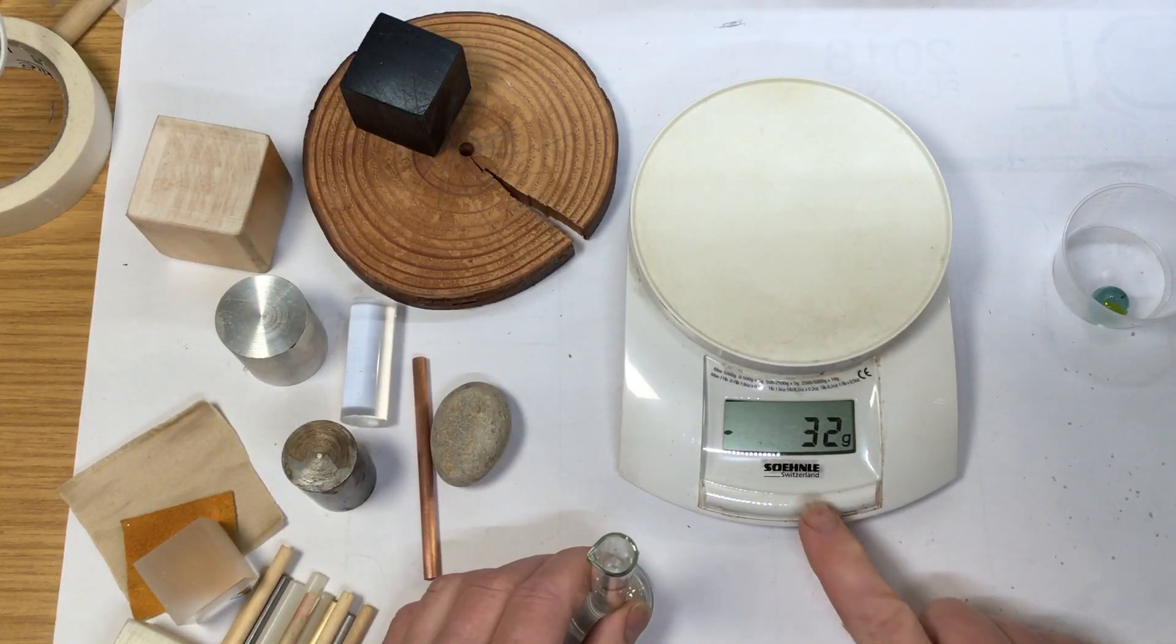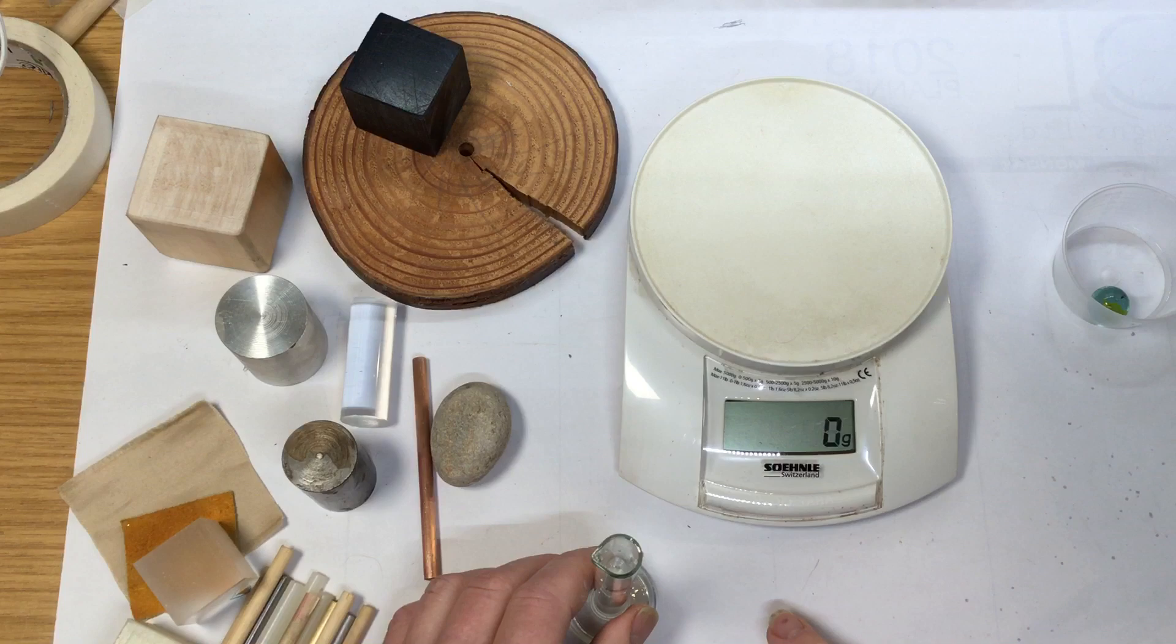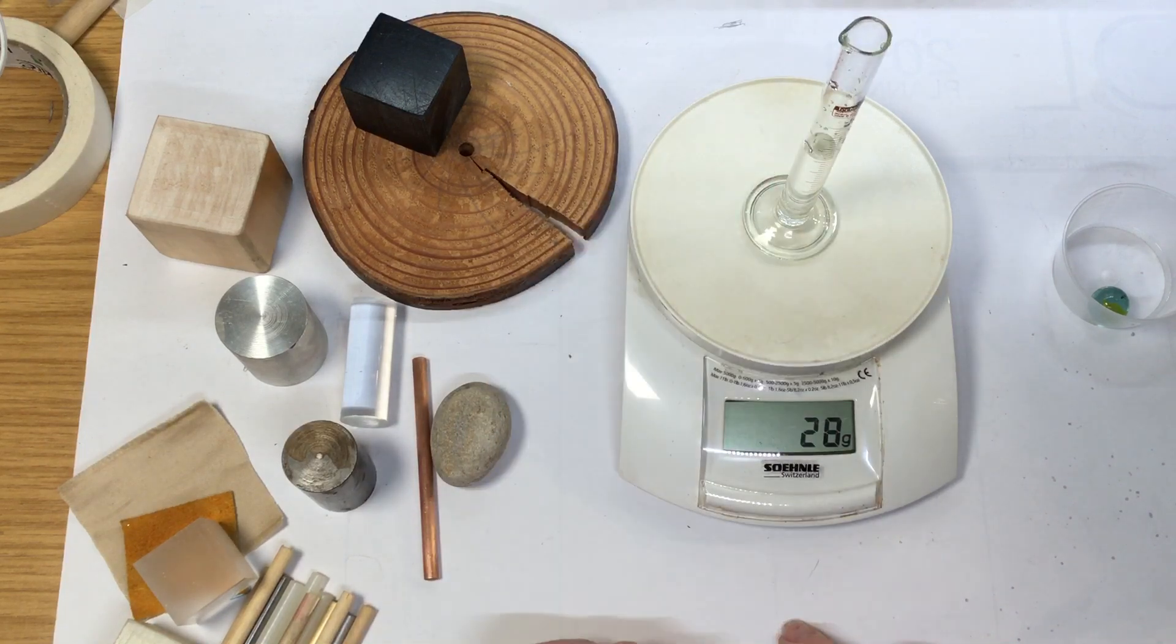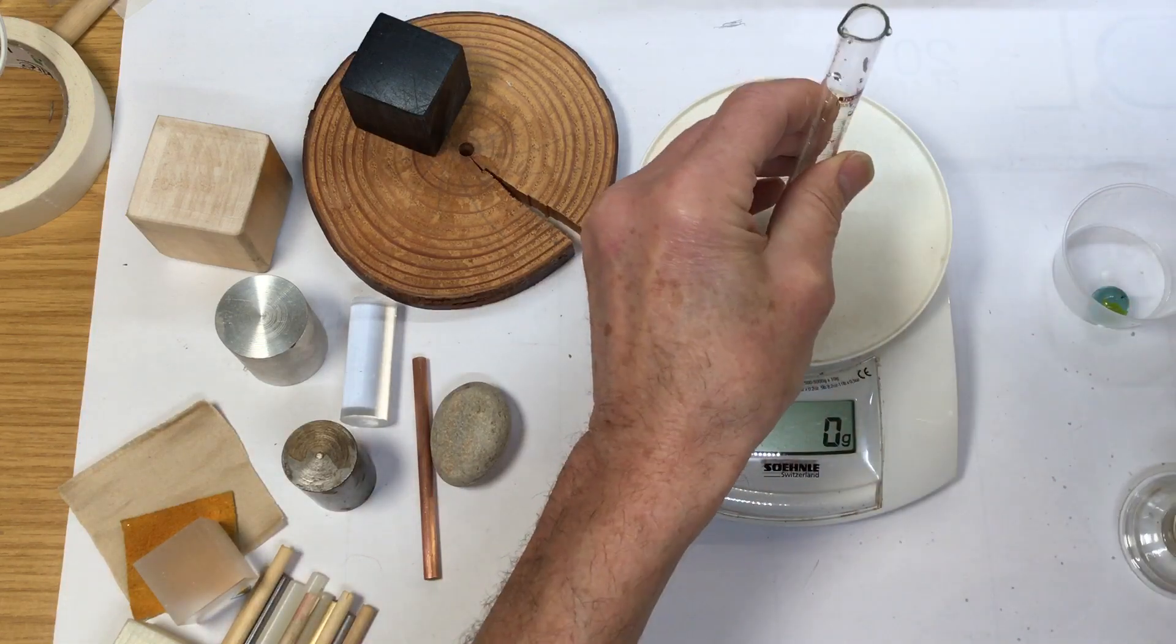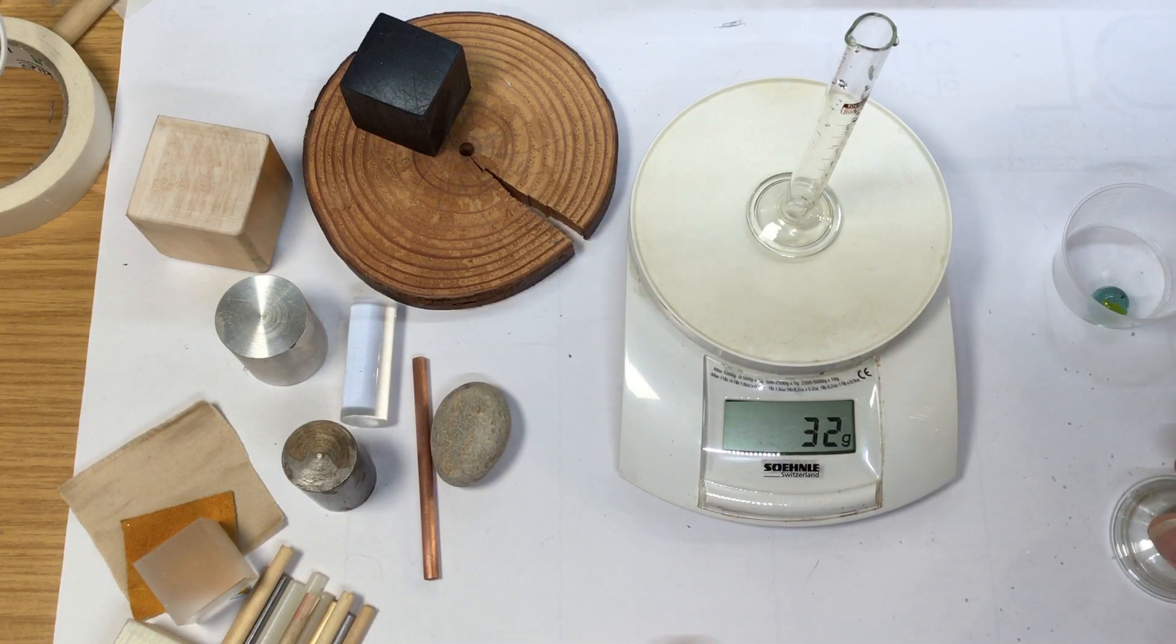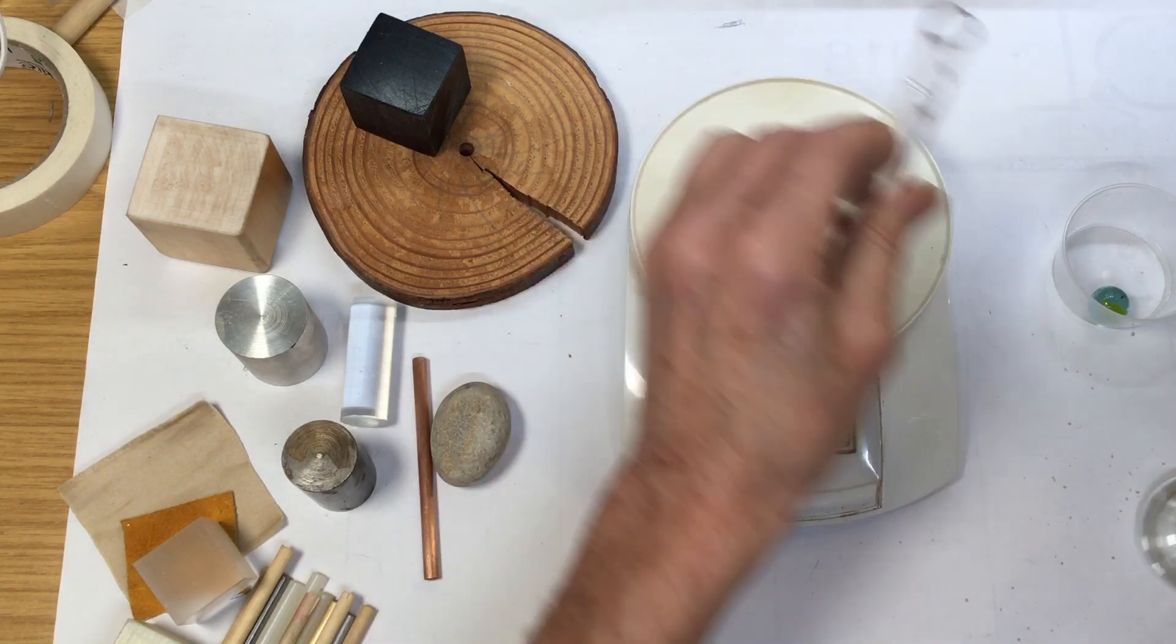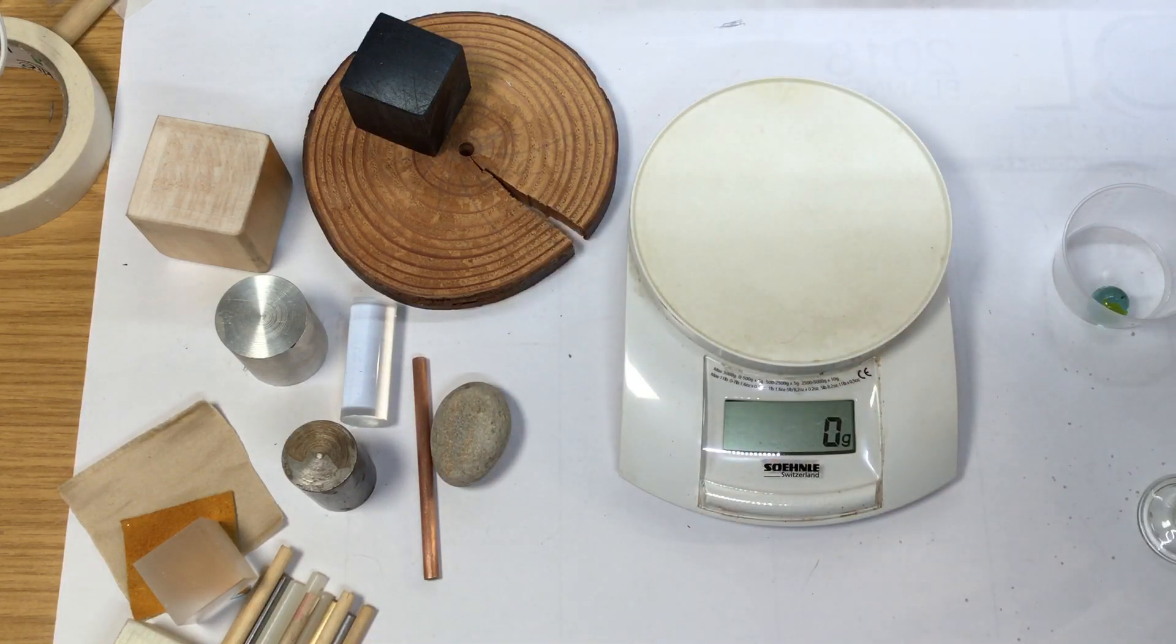Let's have a look again - minus 32, zero it, 38 grams, pour it out, 32... scrap that.